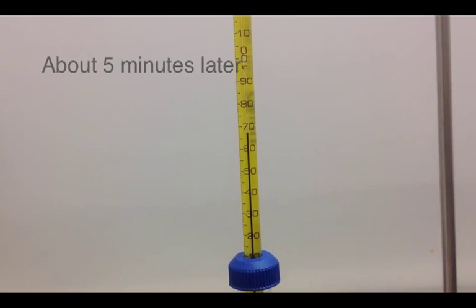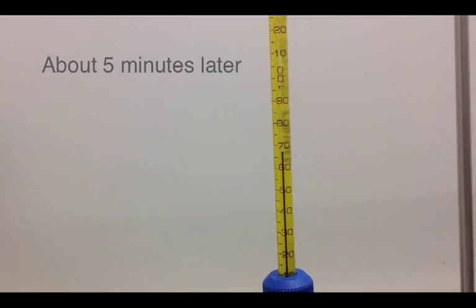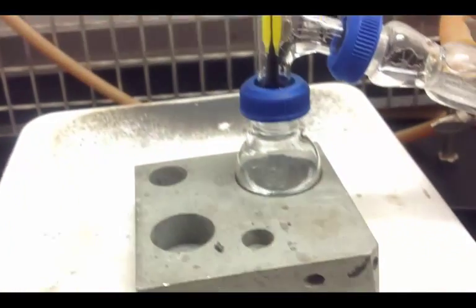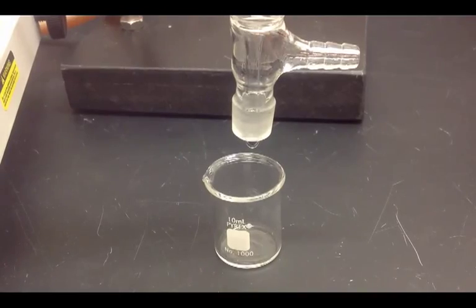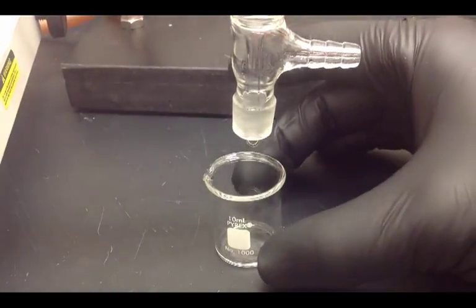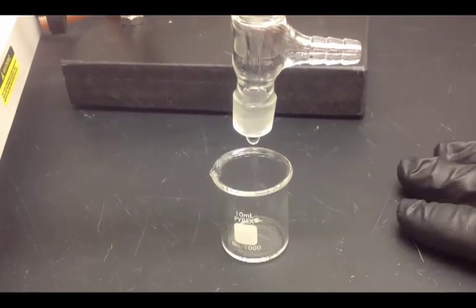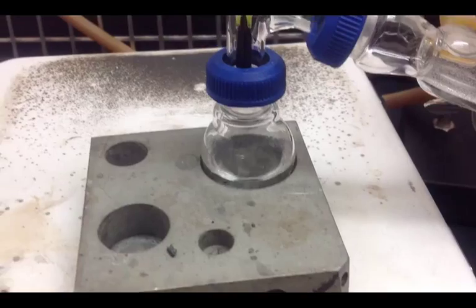All right and we are just about getting up to 65, a little bit above that degree Celsius. And we are going pretty good now. Distillation is going along. Here we are starting to collect our first couple of drops of product. And this is going to be our most pure product right here. This is going to be mostly hexane.